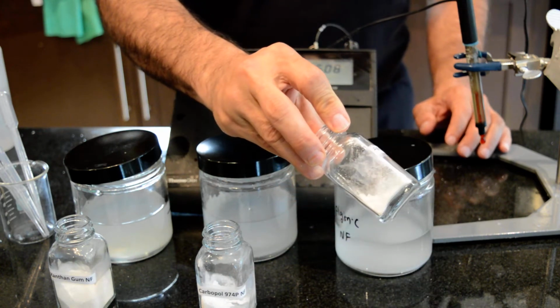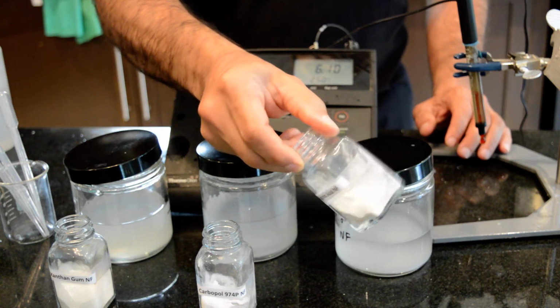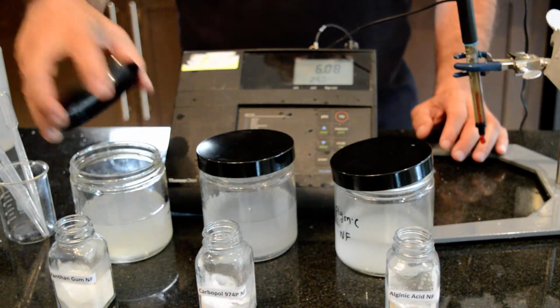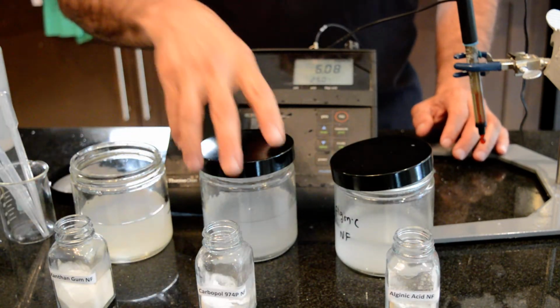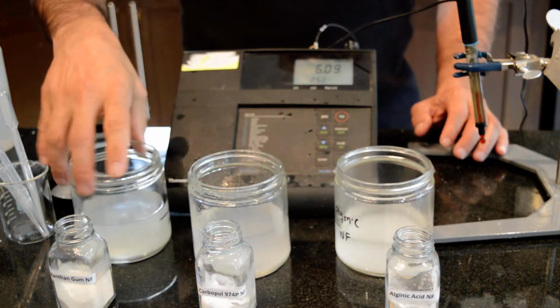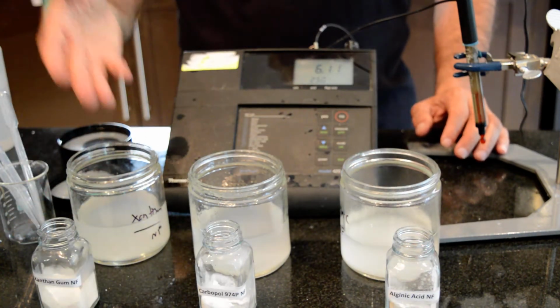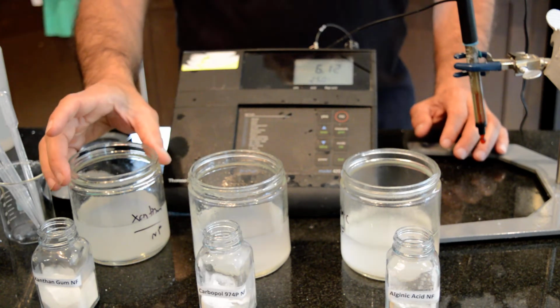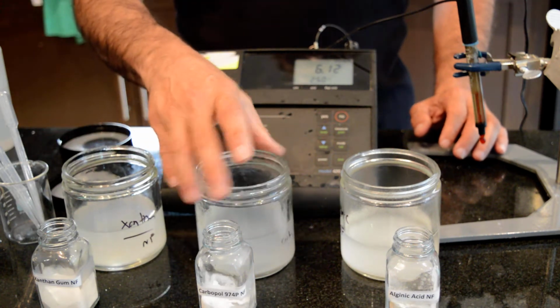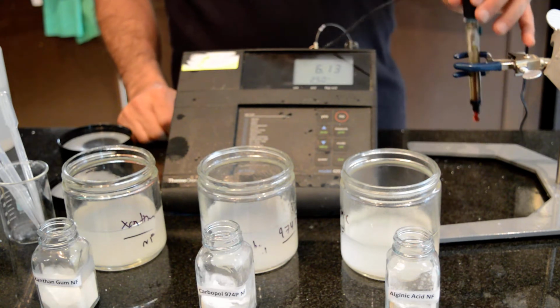The third one is alginic acid, and this also is used as a gelling agent in cosmetic and pharmaceutical. And here I have prepared a 1% solution of each excipient, and they are being solvated overnight. So that's all we did. We just put these excipients, 1 gram in, let's say, 100 ml to make a 1% solution, and this is our end product. What I'm going to do is go and show you the pH of these solutions.